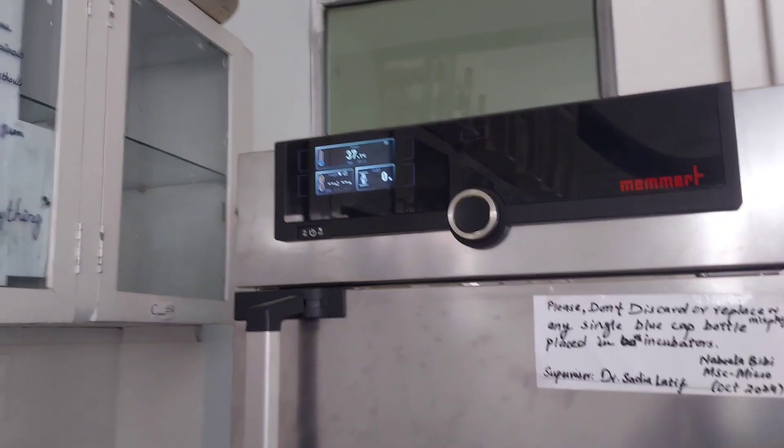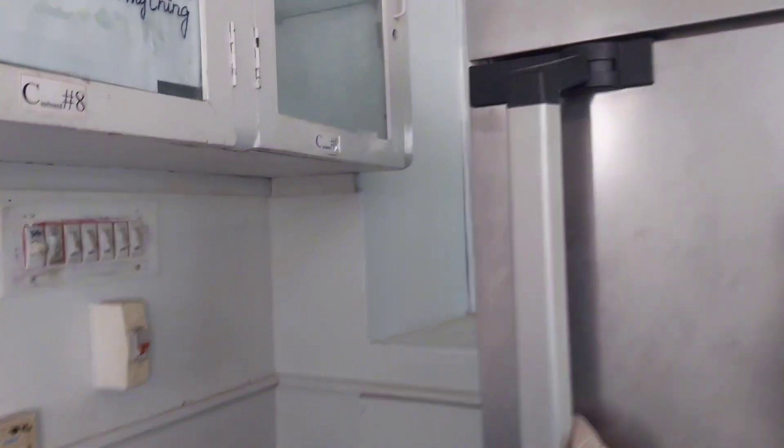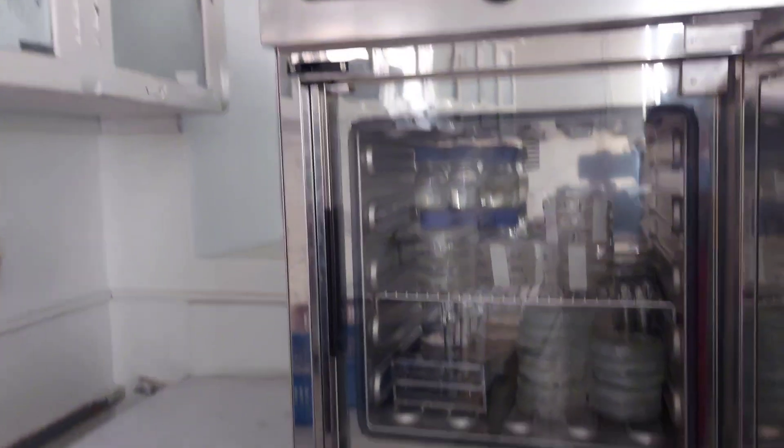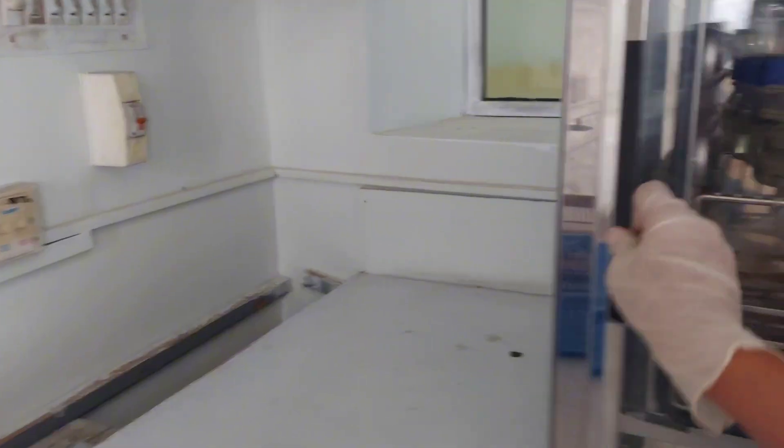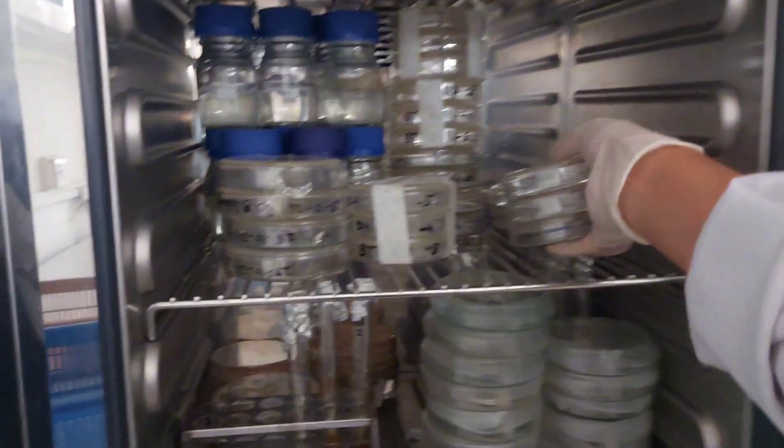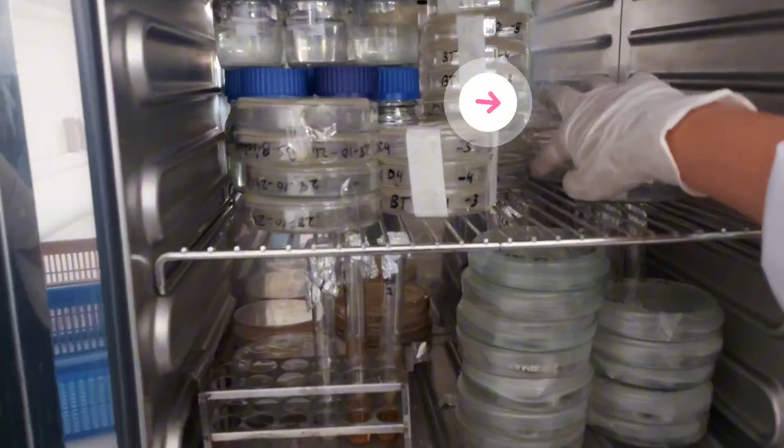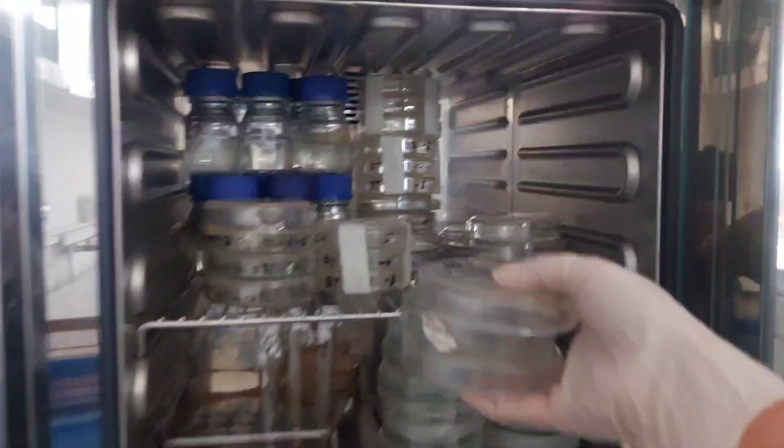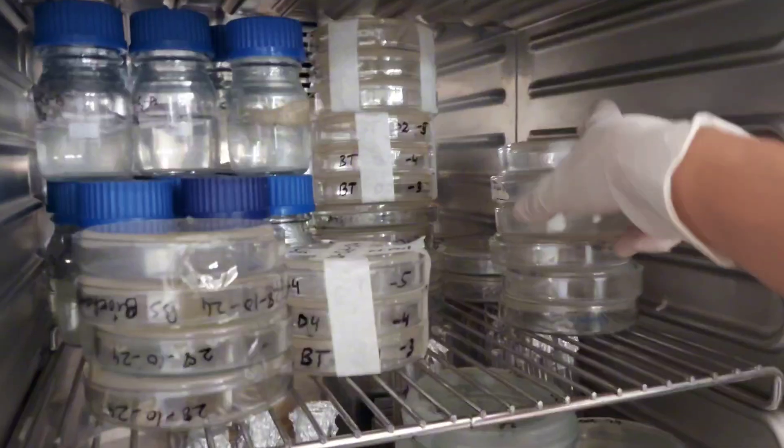Incubate the plates at 37 degrees Celsius for 24 to 48 hours. Ensure the plates are placed upside down during incubation. For fungal flora, use Sabouraud dextrose agar and incubate at 27 degrees Celsius for 72 hours.